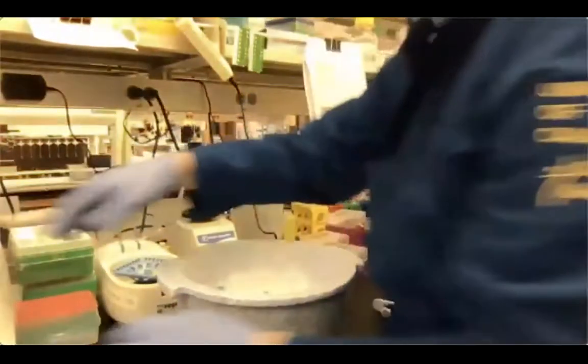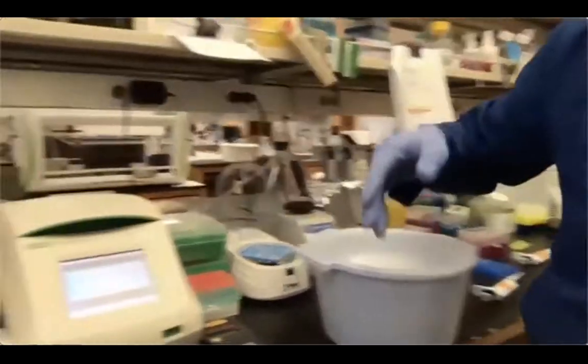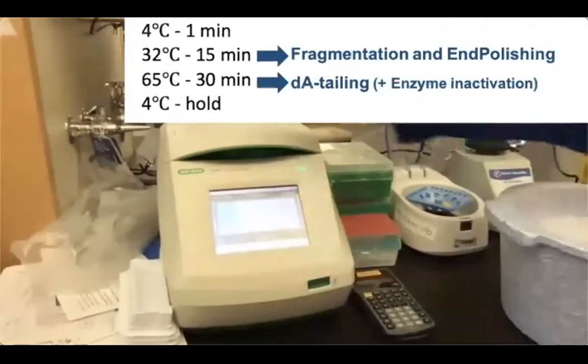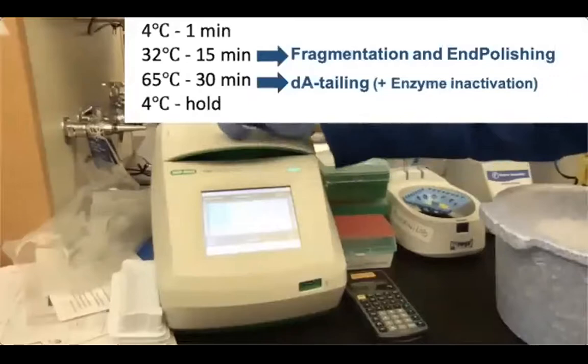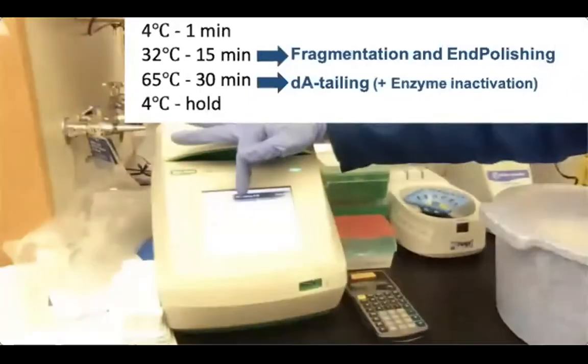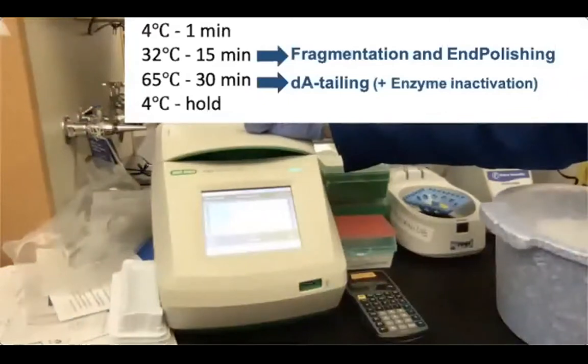Then press start. Okay, so the program, I don't know if you can see it, is basically 1 minute at 4 degrees, and then we have 15 minutes at 32 degrees. And in that step, we're going to have fragmentation and most likely end repair and 5' end phosphorylation.